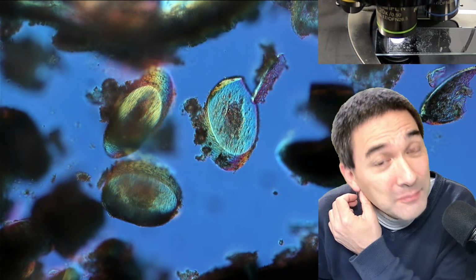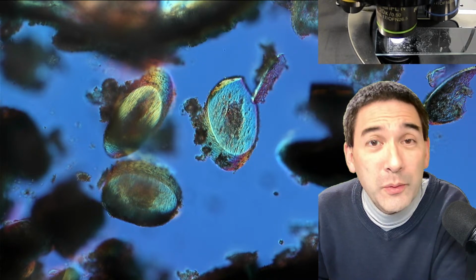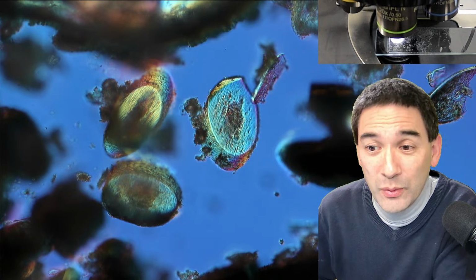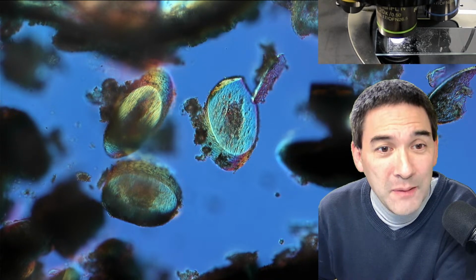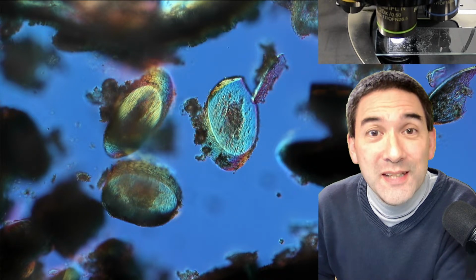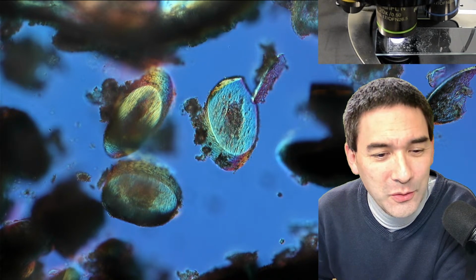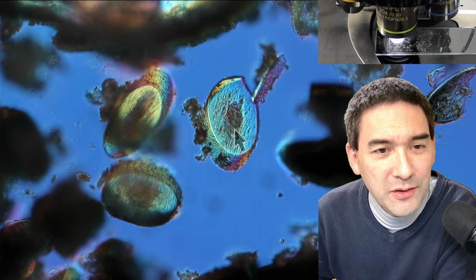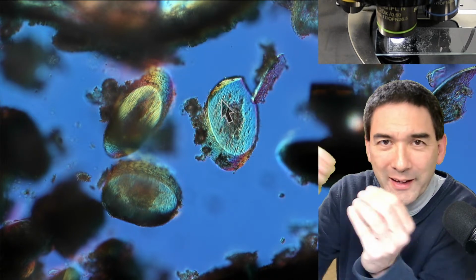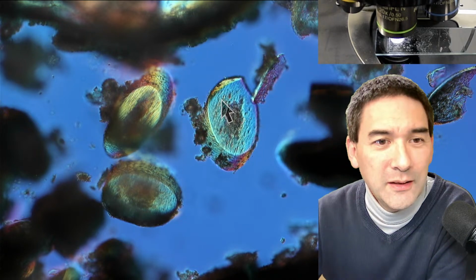Why hair? It's a topic that is not quite very common, I have to say. Normally we look at living things under the microscope, microorganisms, things that move, and I said, well, why not try something different today? What you see right now is actually hair in cross section. And how in the world are you able to get a cross section of the hair? I'm going to tell you, you'll be surprised. Those round things here are like discs of hair. Hair is of course long, but these are cross sections, and there are quite a few of them. The question is, how did I get those cross sections?